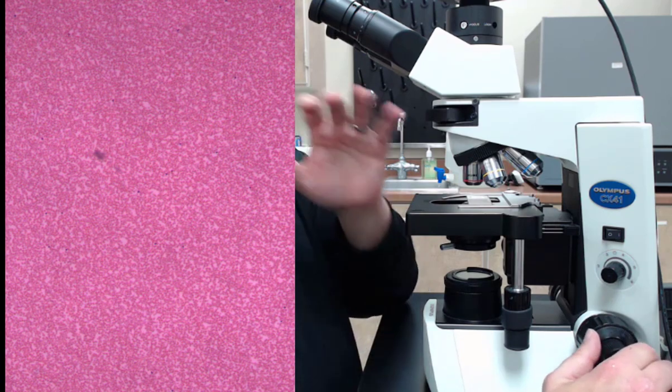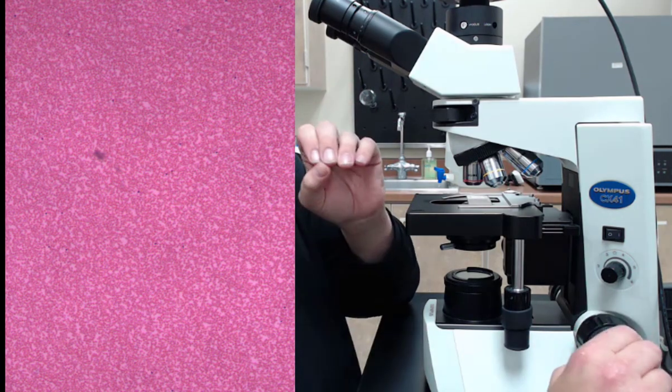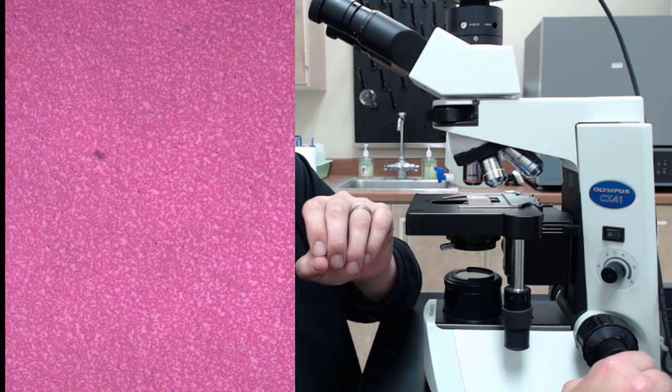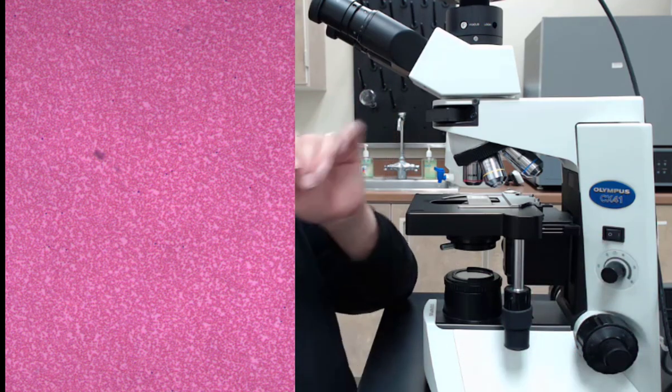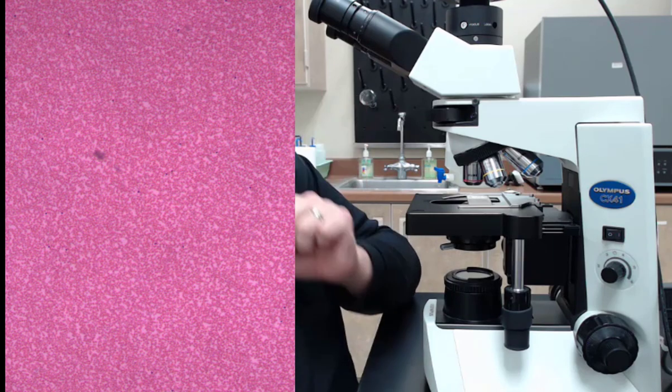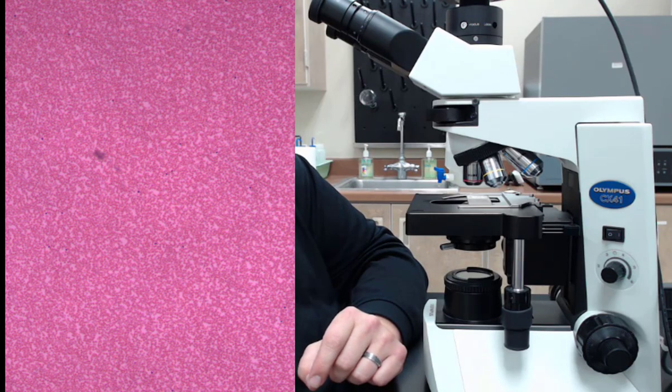Hey, everybody. Dr. O here. I'm actually going to walk you through the microscope all the way from scanning power to the oil immersion system. And I'm going to show you the parts of the microscope as we go, as well as what you're seeing through the ocular inside the microscope. So let's go ahead and get to it.